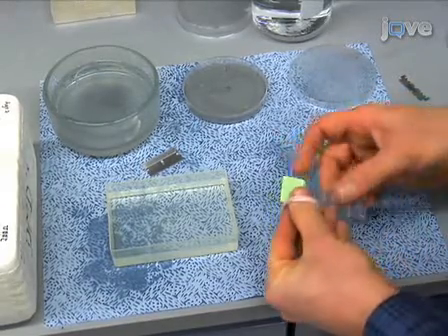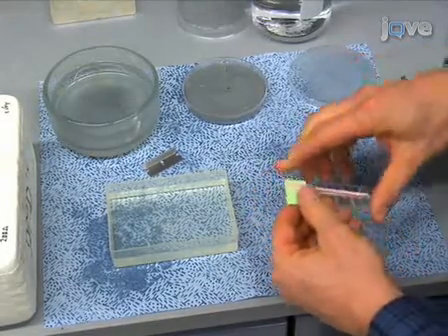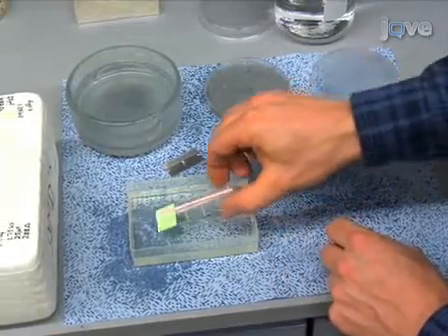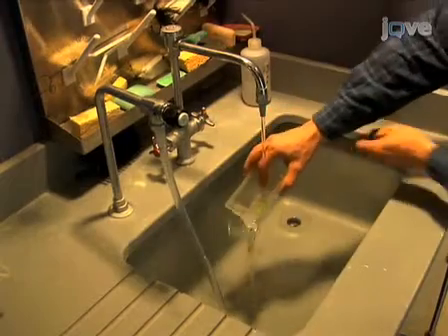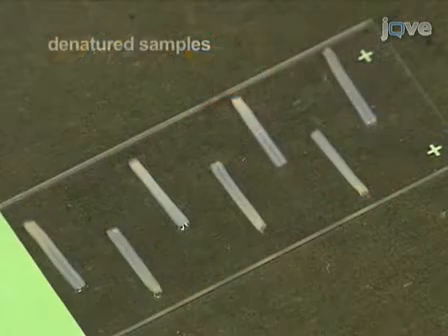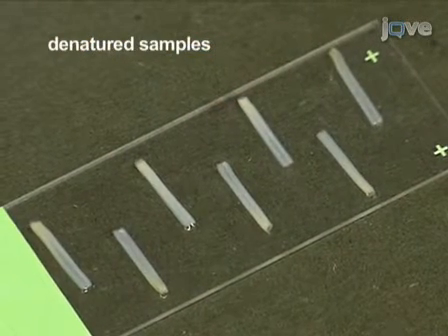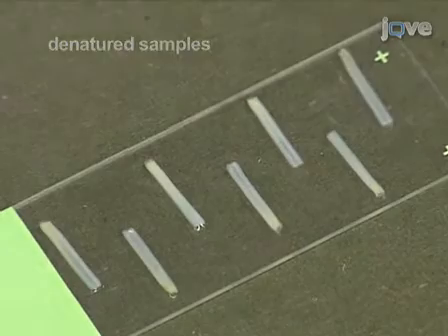To do this, we bind the glass slides together with a pair of rubber bands, put the assembly in a container with 100 milliliters of deionized water at room temperature, and place it in a microwave oven at full power. With our microwave oven, the water starts to boil at about 50 seconds, and we stop the microwave 15 seconds after boiling begins. The hot water is quickly poured off and replaced with cold water to stop denaturation. Optimal heating will mean that samples will lack any responsiveness to low pH, while at the same time not become weak and break easily.